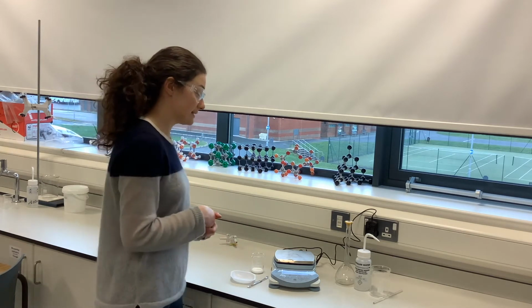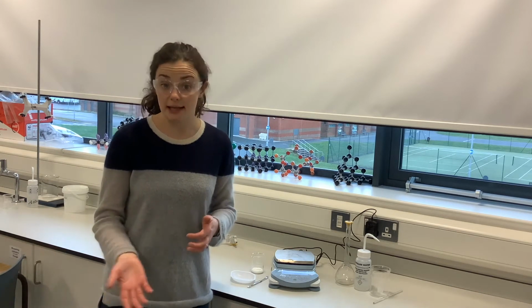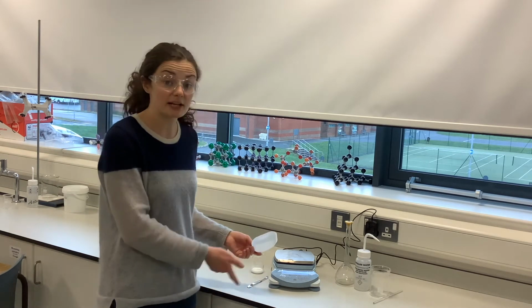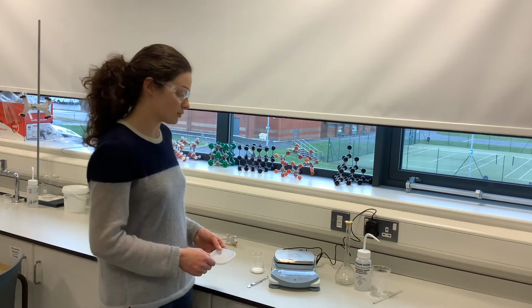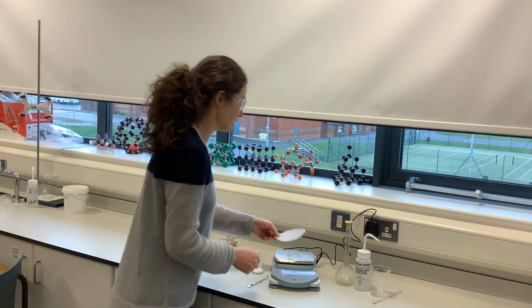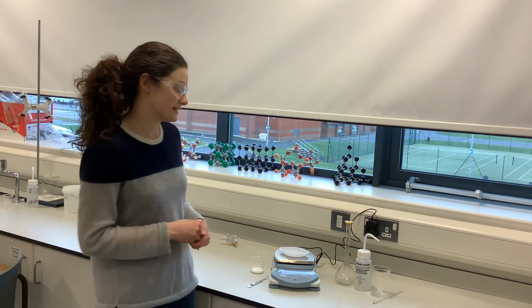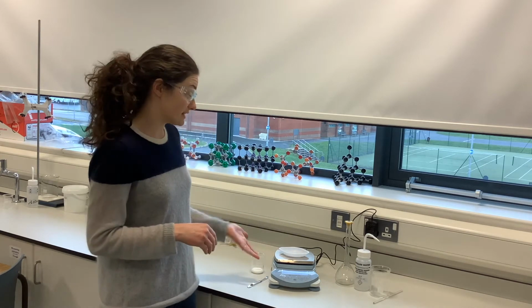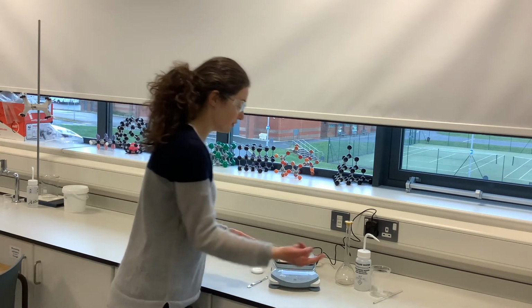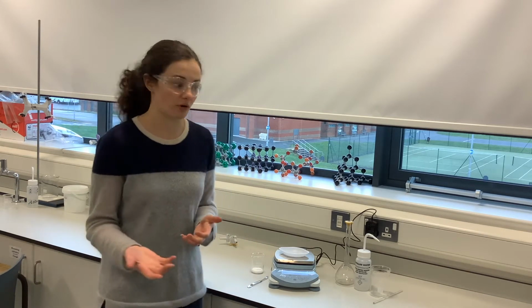So what I've got here is a mass balance, and it's important that it is to the degree of accuracy that I need to measure out. 2.86 grams is to 2 decimal places, so I need a 2 decimal place mass balance, and that's what we have here. This is simply called a weighing boat. It's just a plastic boat that we can then dispose of. When I put that on the mass balance, you might not be able to see the numbers clearly in the video, but that's 2.75 grams. So I can just zero the mass balance so that I can measure out my 2.86 grams of my salt.